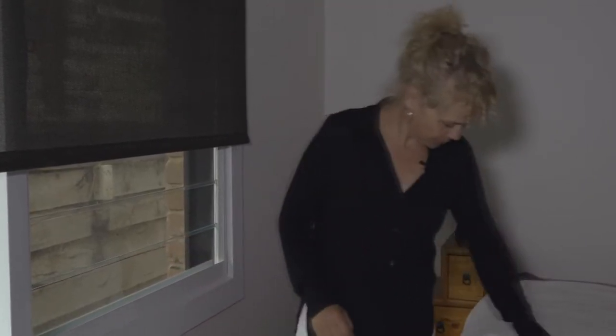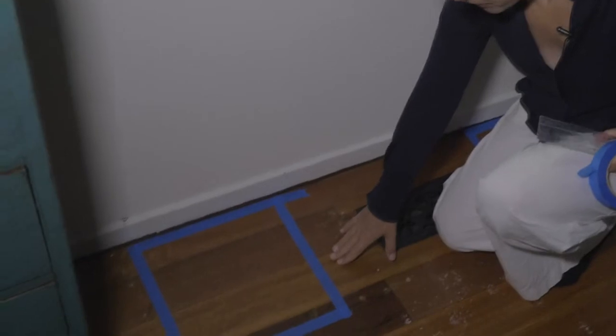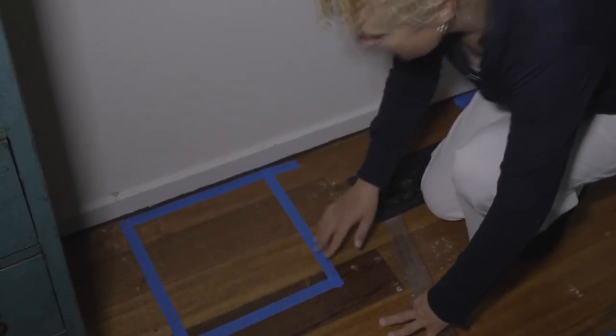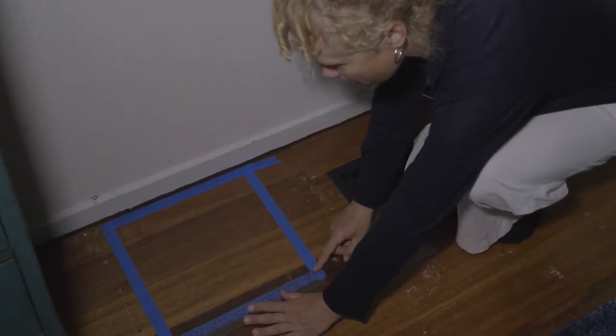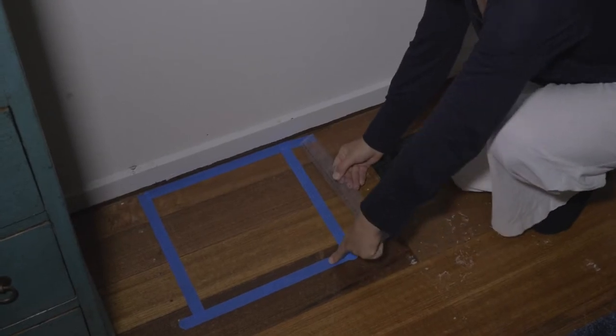When it comes to dust wipes, you need to define the area, and it needs to be at least 900 square centimetres, and that can look something like this. It can be a 30 by 30 centimetre, and what I mean by that is the internal area is 30 by 30 centimetres. So I've double checked that with my ruler. Make sure you don't include the tape itself.